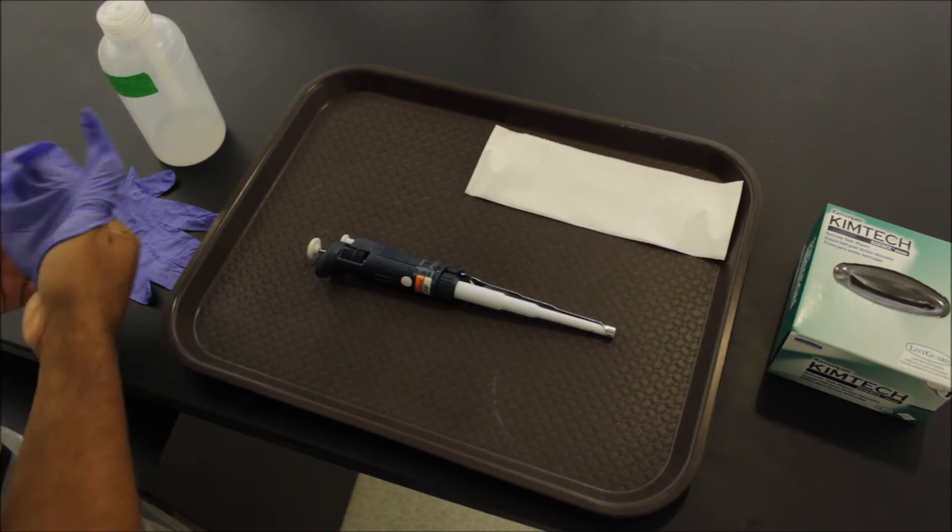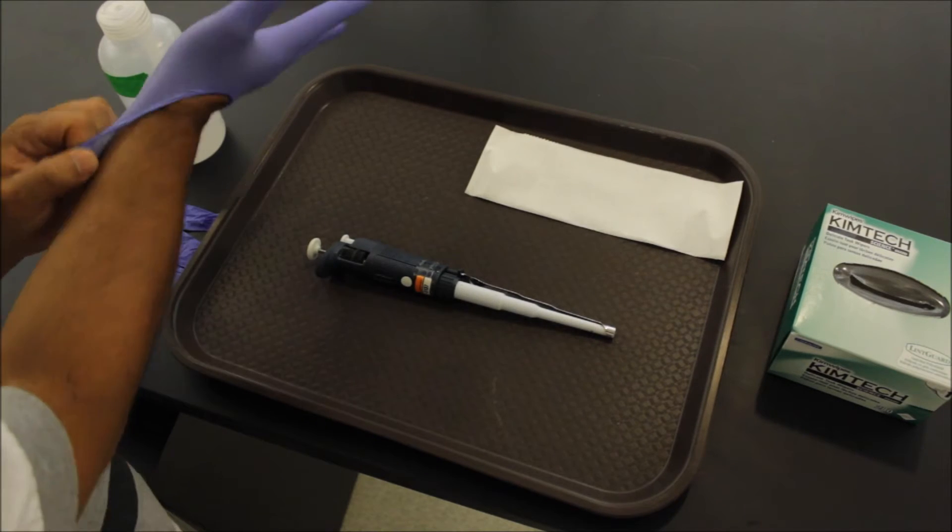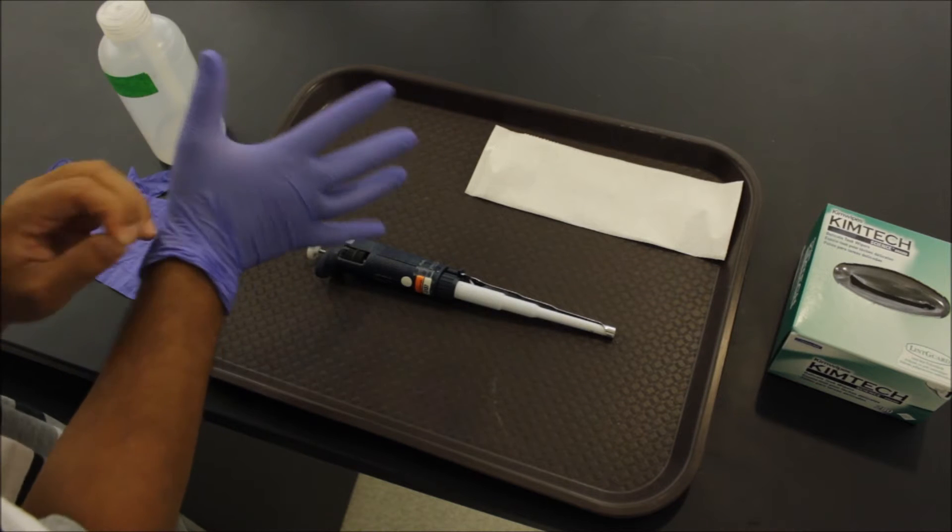Alright homies, so today we're going to go through with the pipette cleaning. As always, set your pipette to max, which in this case is a thousand.